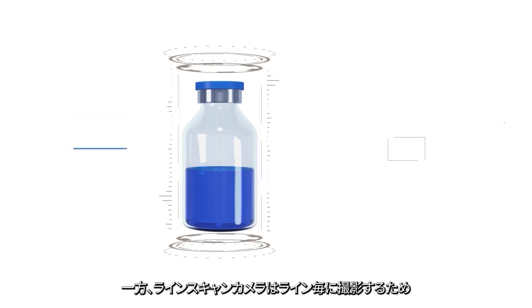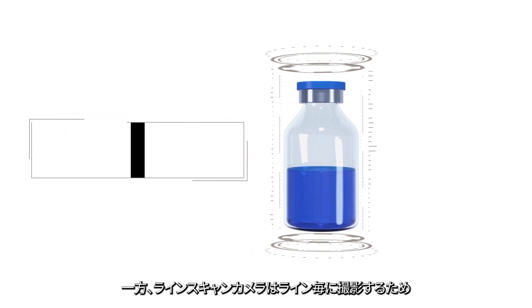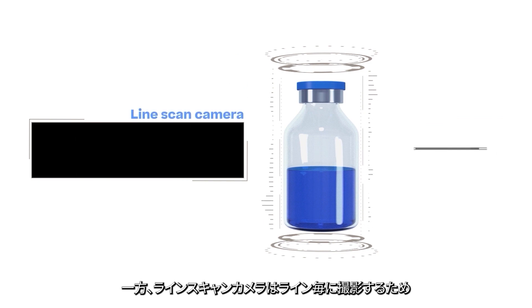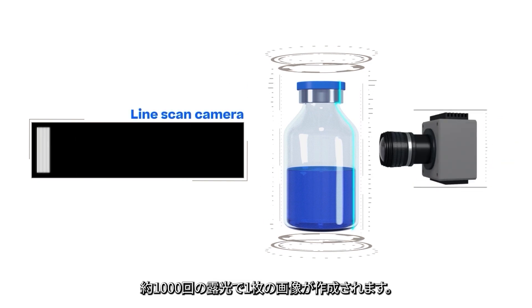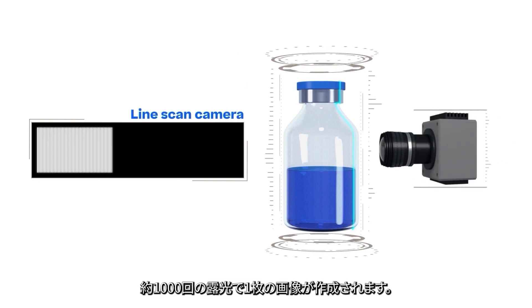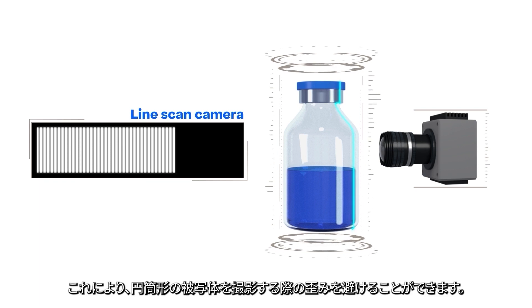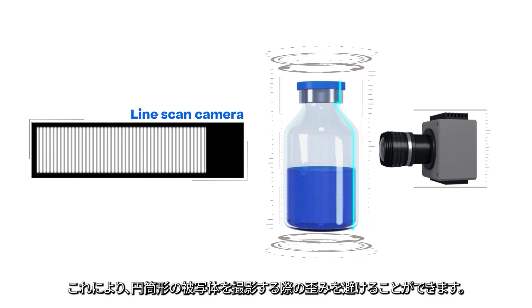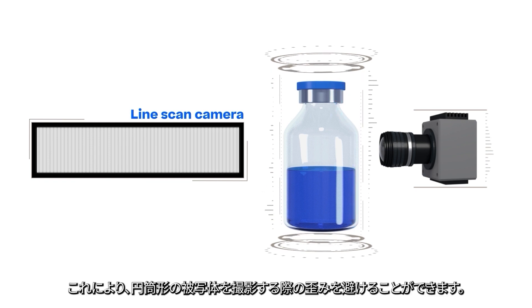The line scan camera, on the other hand, captures line by line so that an image is created from about a thousand exposures. This avoids distortions when taking pictures of cylindrical objects.